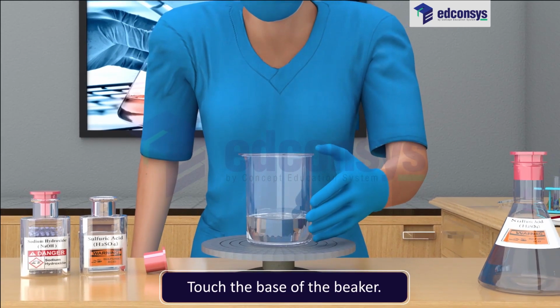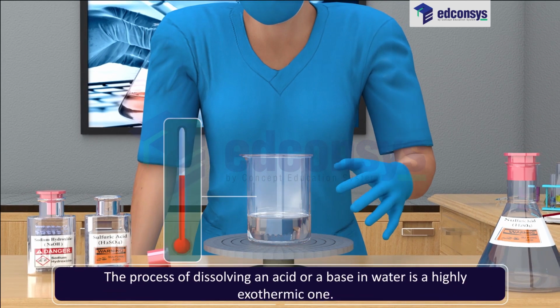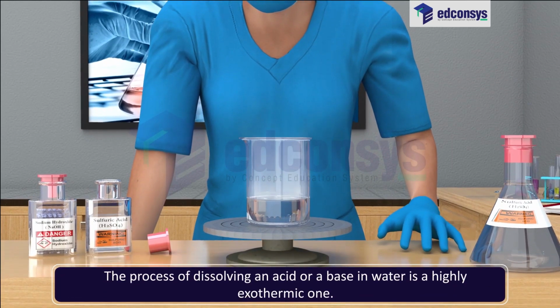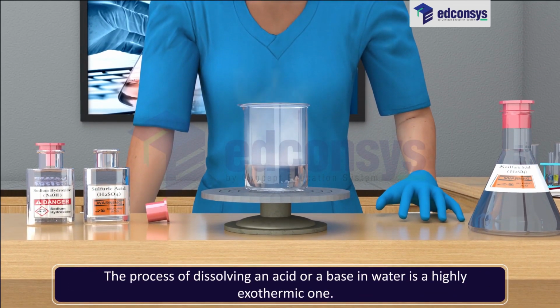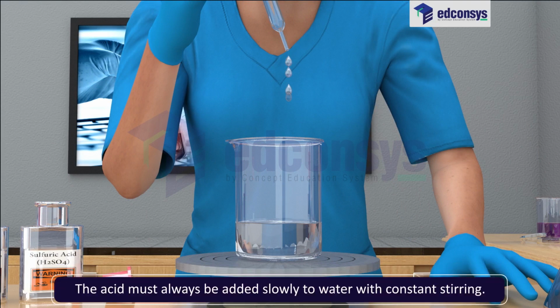Touch the base of the beaker. There is a change in temperature. The process of dissolving an acid or a base in water is a highly exothermic one. Care must be taken while mixing concentrated nitric acid or sulfuric acid with water. The acid must always be added slowly to water with constant stirring.